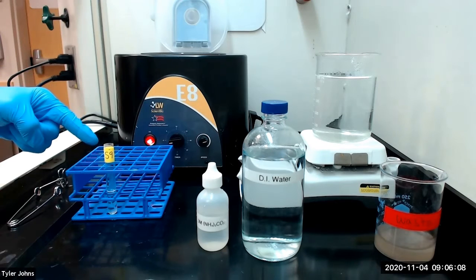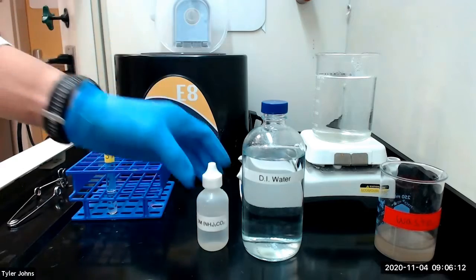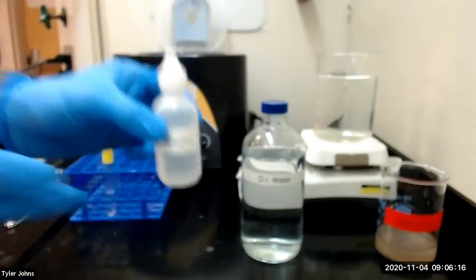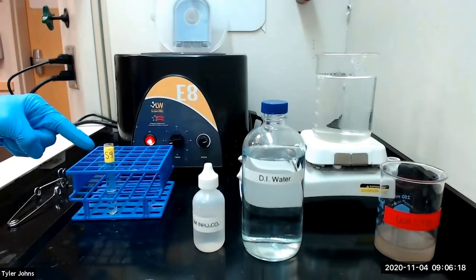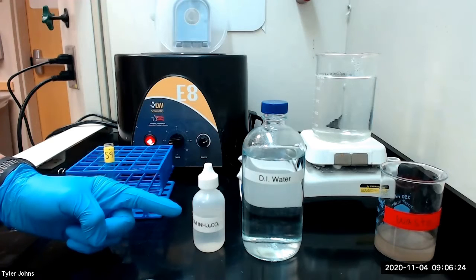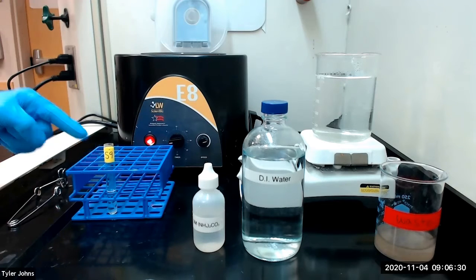After heating the S9 solution and evaporating the total volume down to 3 to 4 milliliters, we will next add 3 molar ammonium carbonate dropwise to the solution until it is just basic. After the solution is just basic, we will then add an additional 1 milliliter 3 molar ammonium carbonate. We will then mix well and allow the solution to stand to complete any precipitation.